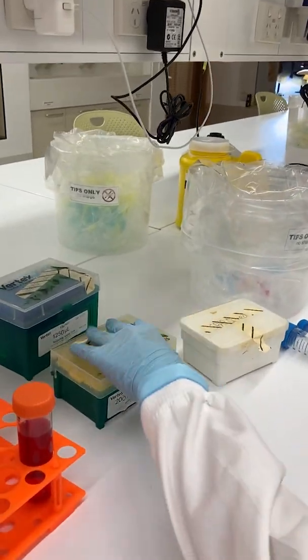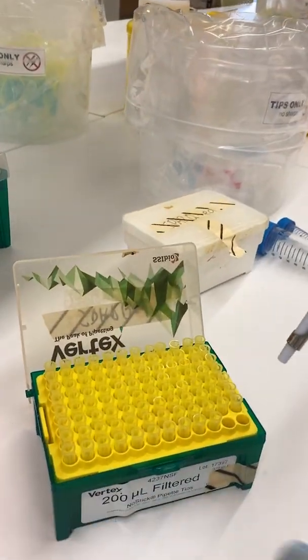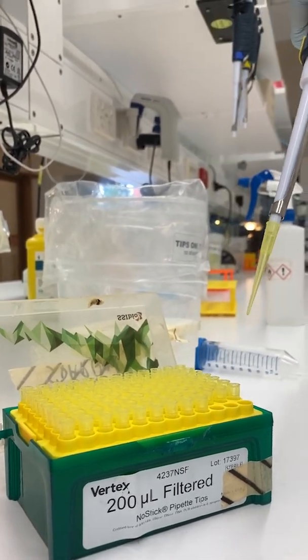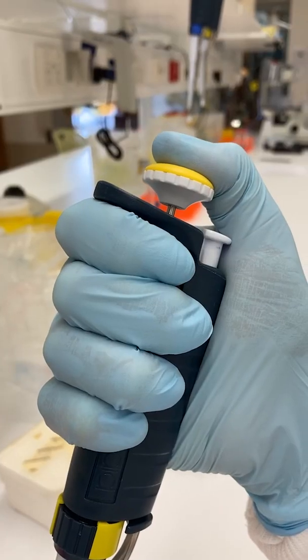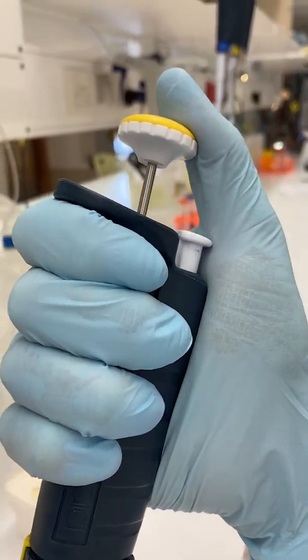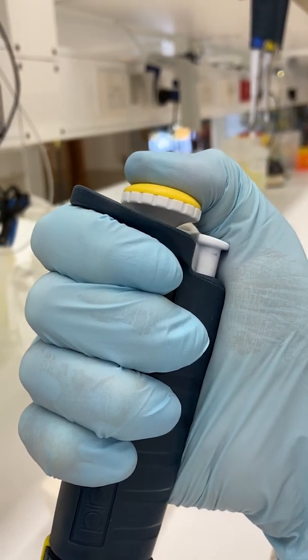Next, you will need to apply a disposable tip to the pipette. Each pipette's size has a matching size of tip. Sometimes these are colour-coded. Here we are using a P200 pipette with P200 tips. Now depress the plunger on the top of the pipette. Notice there are 2 stopping positions. The first stop is used when taking up liquids, and the second stop is used to dispense the liquid.